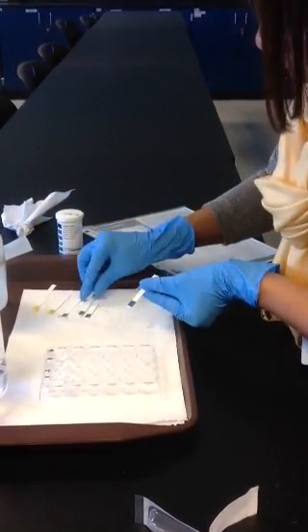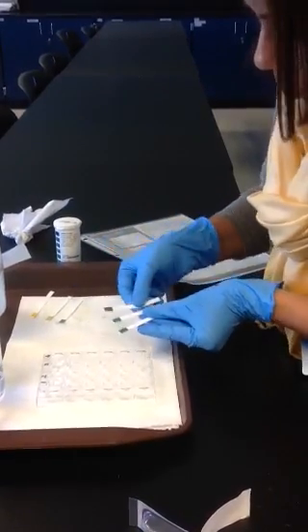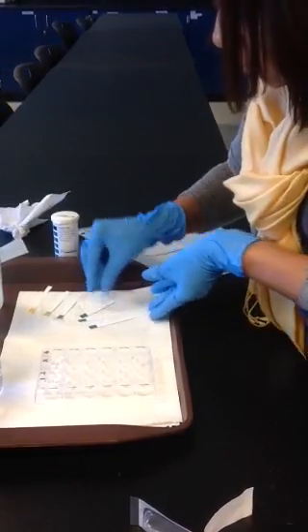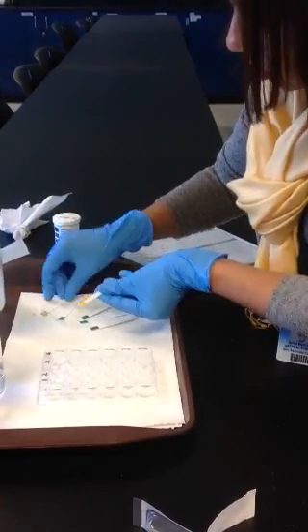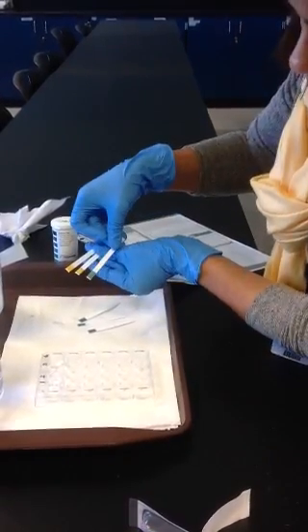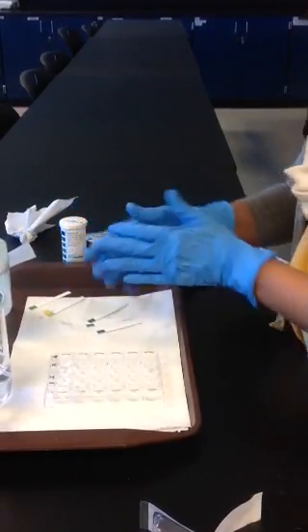And if you see here, notice these 3 look pretty similar, and you can see this is the original. You can see these different. So that concludes this activity.